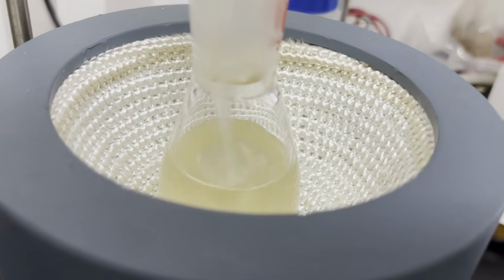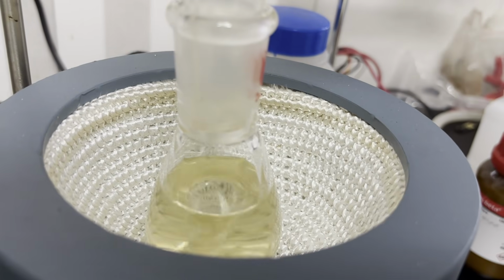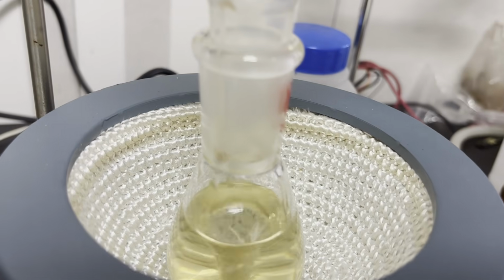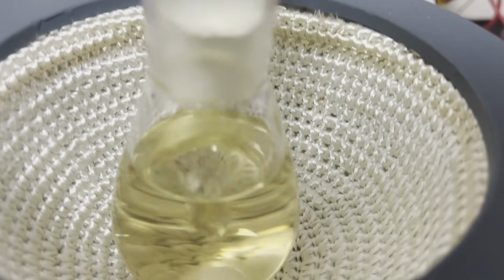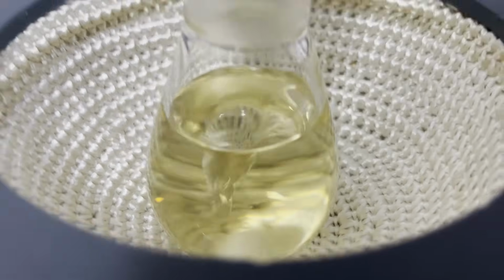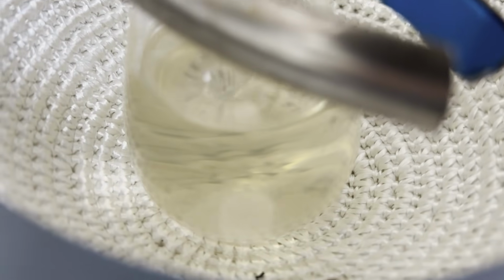Finally, I added in 14 ml of glacial acetic acid, and nothing seems to happen. The acetic acid froze during the winter, proving that it is likely pure and free from water. The slightly yellow mixture is allowed to stir at room temperature for 2 days, as the literature required. Now here's where interesting things start to happen. My first attempt of this reaction was in winter, and even after 3 days, no reactions seemed to take place.